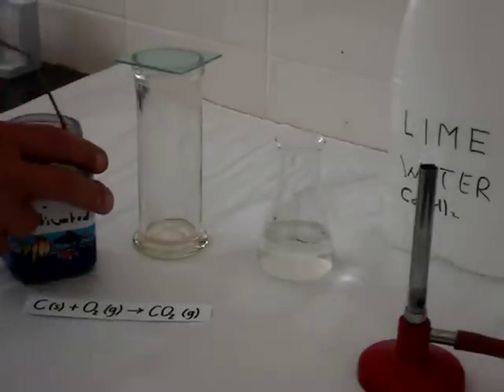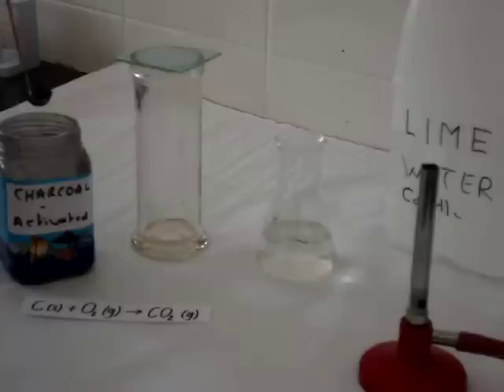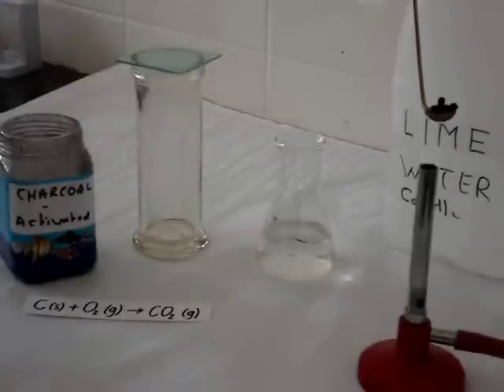We're going to plunge it once it's started burning into a gas jar. So we heat it over the flame of a Bunsen burner.